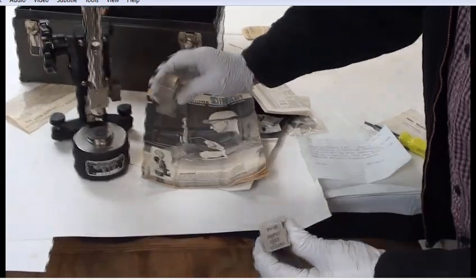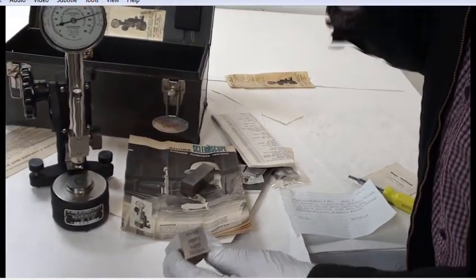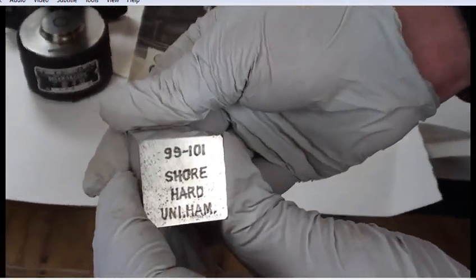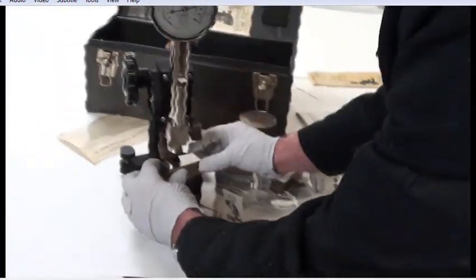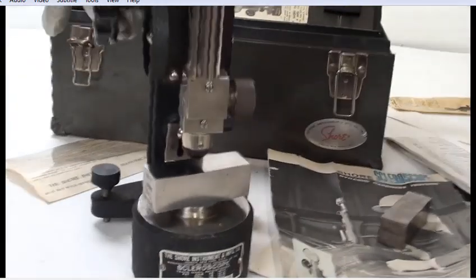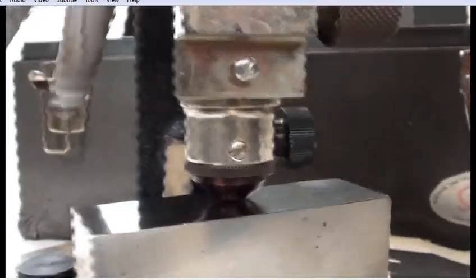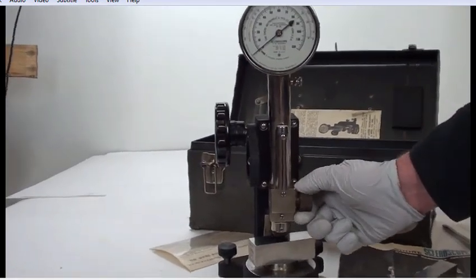We have two hardness standards. The first one is a 99-101 hardness standard. We place that down there, bring the probe down to touch, and then we reset.